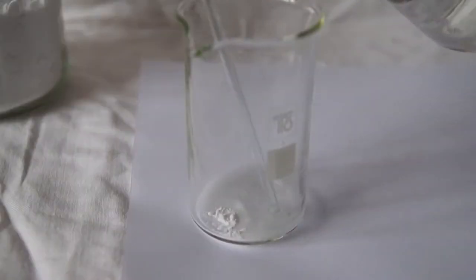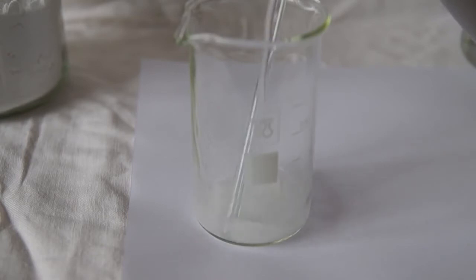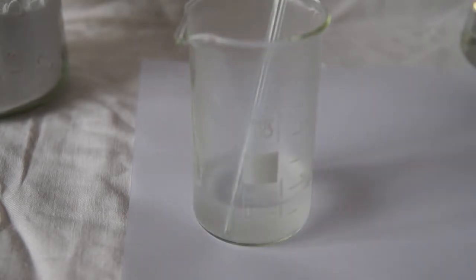Dissolve starch in cold water, then pour boiling water into the beaker to better dissolve the starch. The solution becomes slightly cloudy.